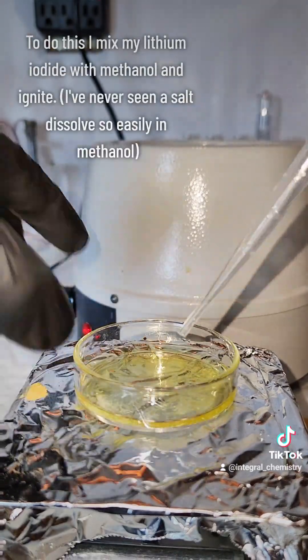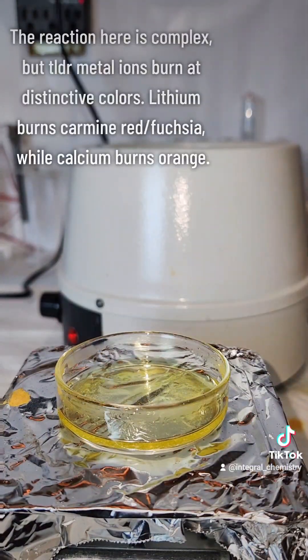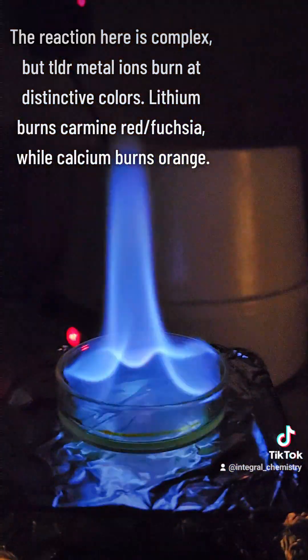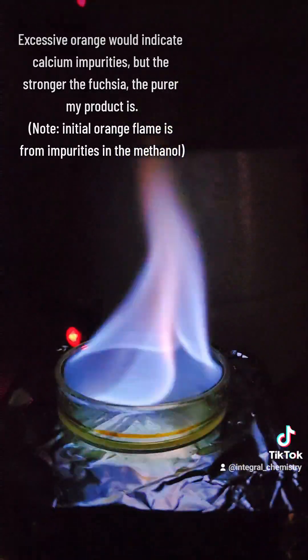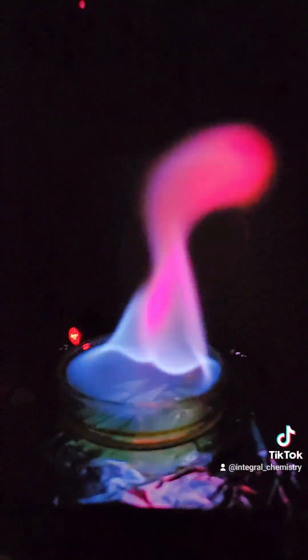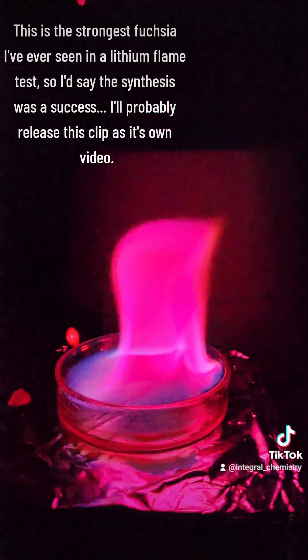To do this, I dissolve my lithium iodide in methanol and ignite it. This will burn the methanol and any metal ions present along with it. The heat will energize the electrons bound to the ion and they will emit a photon of light to get rid of that excess energy. The metal ions in solution can be identified this way as each metal ion emits a unique color. Lithium's unique color is a carmine red, almost fuchsia, while calcium's unique color is a dark orange, almost a brick red. I can see that this is the strongest fuchsia I've ever seen in a lithium flame test, so I'd say this was a success.